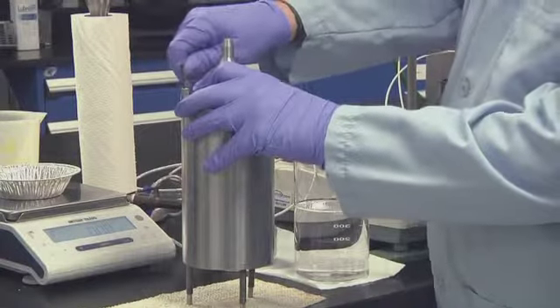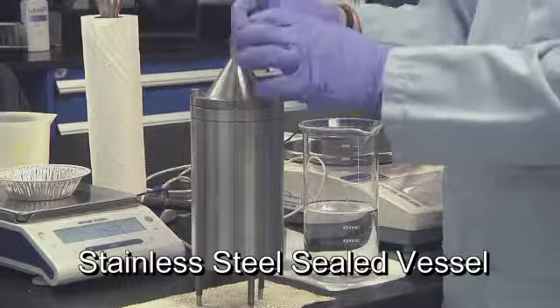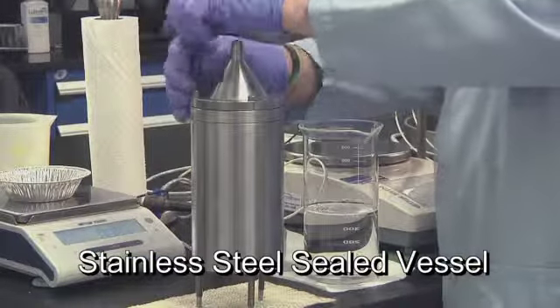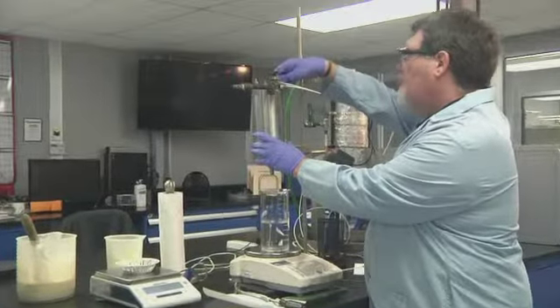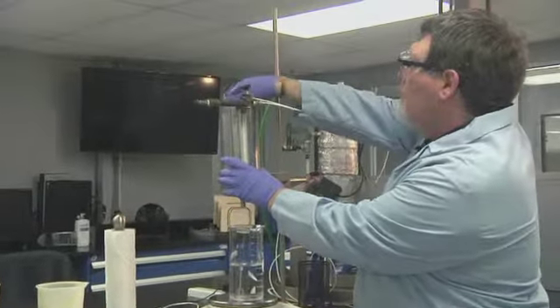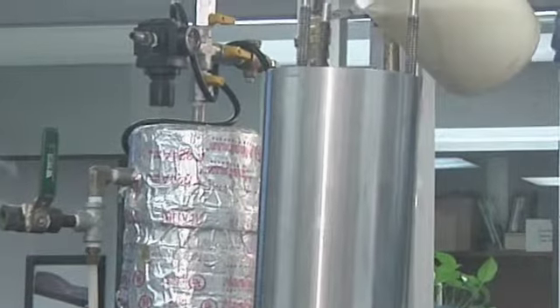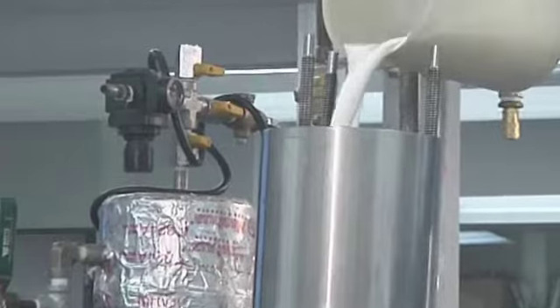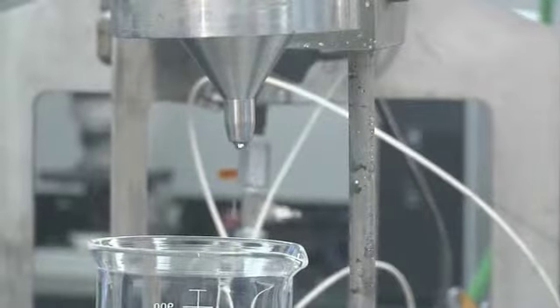The Andritz sludge resistance meter is a stainless steel sealed vessel which is pressurized by a regulated supply of bottled nitrogen gas or air. To simulate a recessed plate filter press, a known sample volume is poured into the vessel. The pressure forces filtrate through the solids, which are retained by a filter cloth.